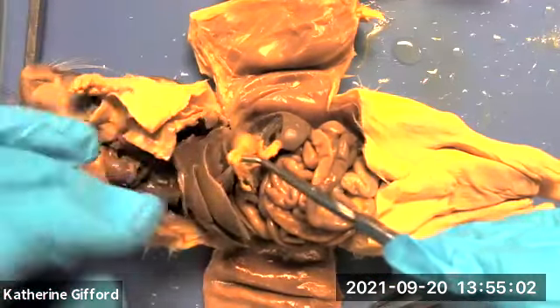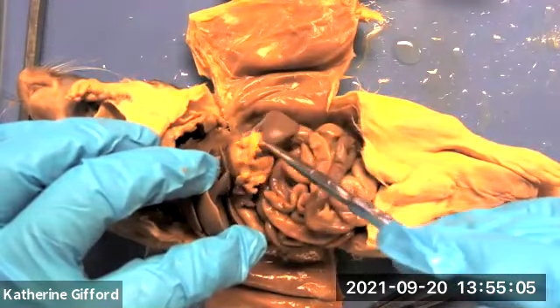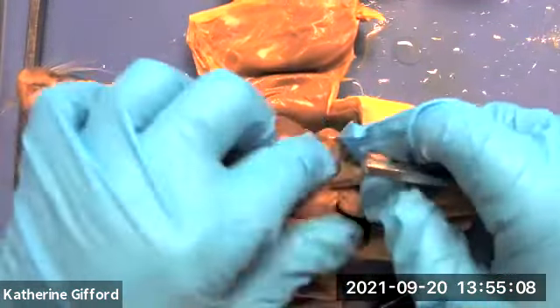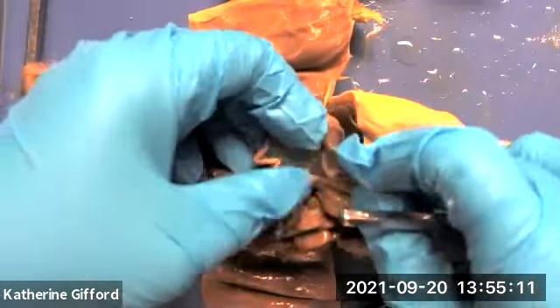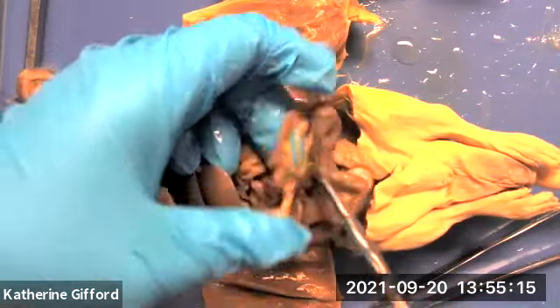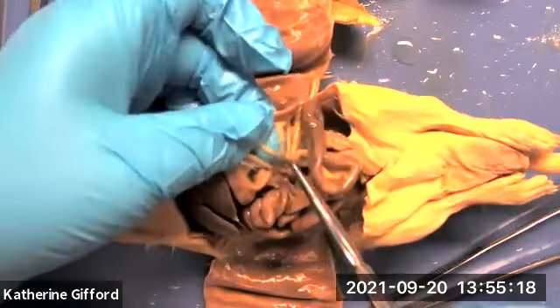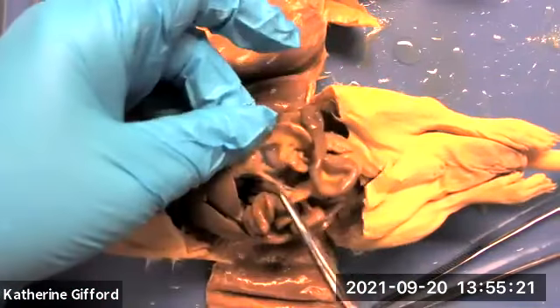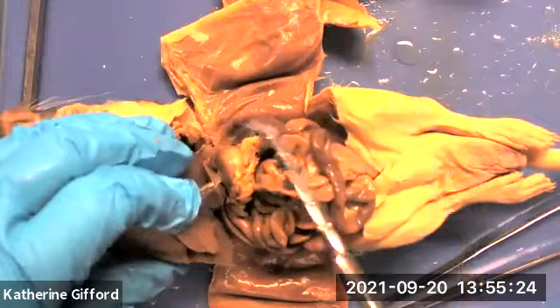This is part of the greater omentum. If we hold up the intestines, we can see the mesentery — it's transparent. This is part of the parietal peritoneum.